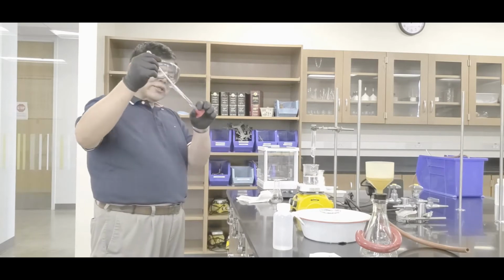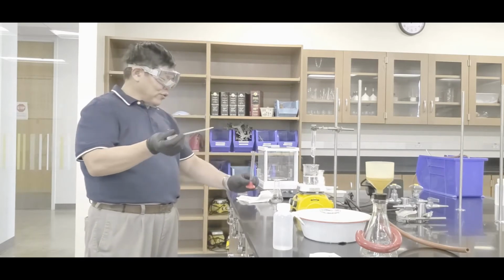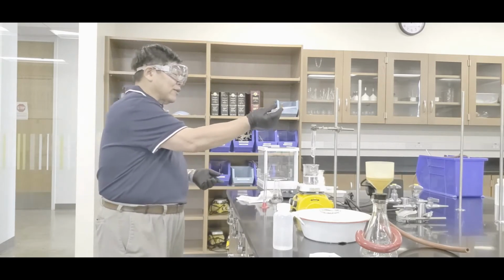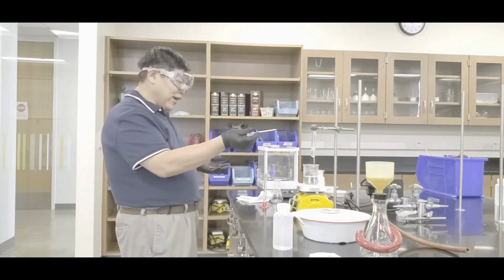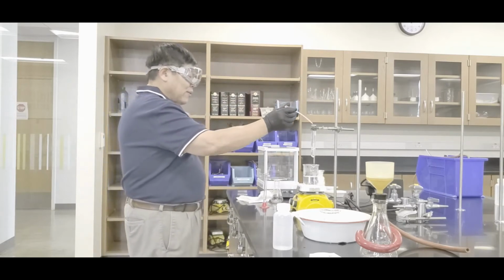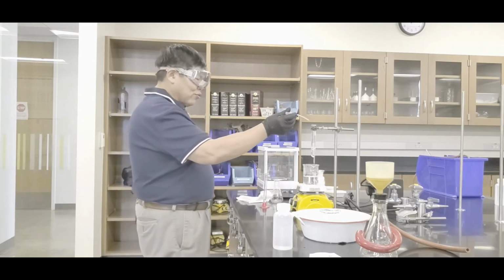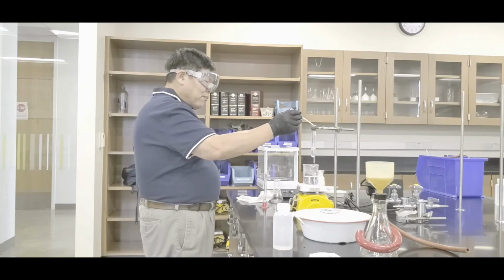So here's a 5, and what you want to do is like this. You want to be at arm's length away from this thing, and you want to put the tip in there. Do not stand like this, because you don't want that thing to splatter up at you, just in case. So here we go. If it's my class, I would coach the students through. But this is what you do. Go drop, drop, drop, drop, sort of like that, okay?